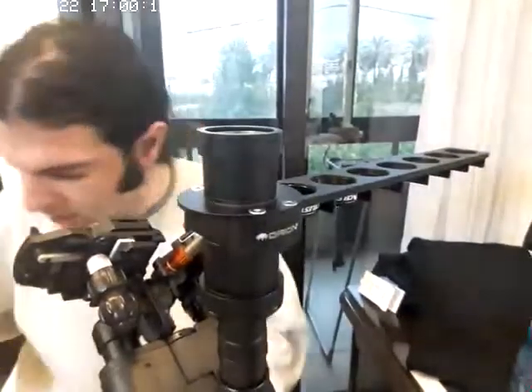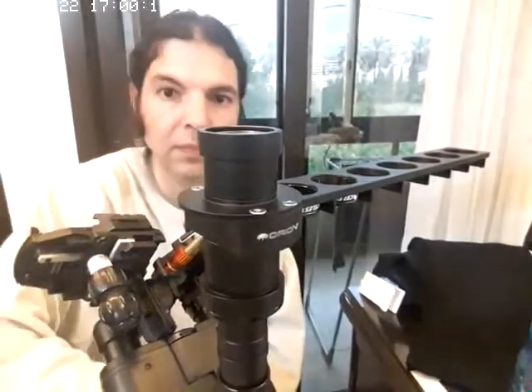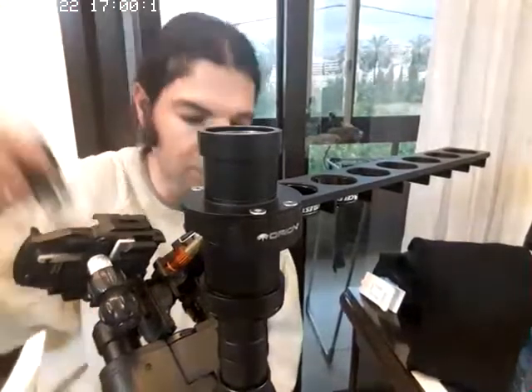So now we have it like this. No, not this way.